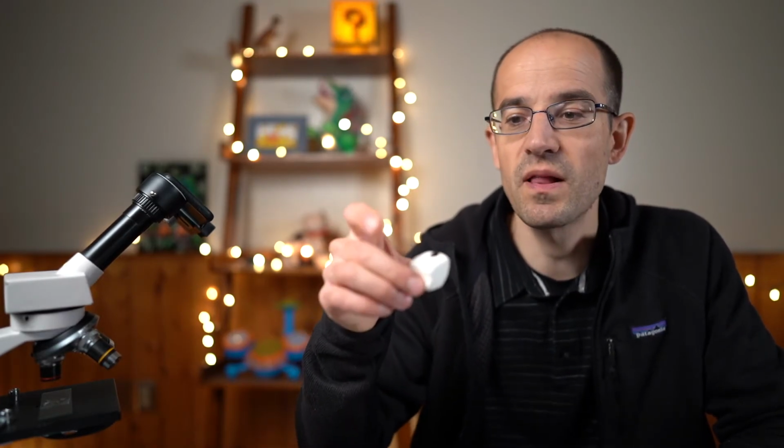Another interesting one is the marshmallow. Why is the marshmallow a positive test if it's just sugar? Why is the M&M a positive test if it's just sugar? They coat those things in starch so they don't stick as much. But the majority of those sweet products are sugar. They're just dusted in starch to prevent them from sticking.